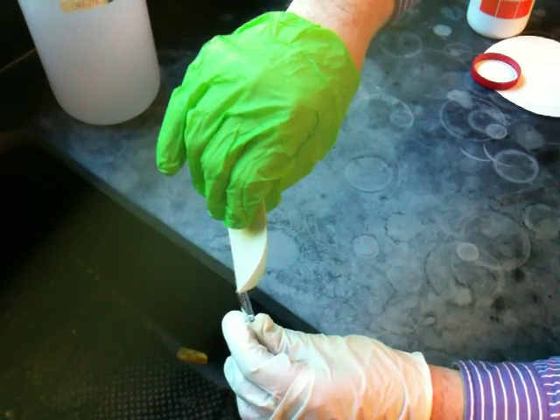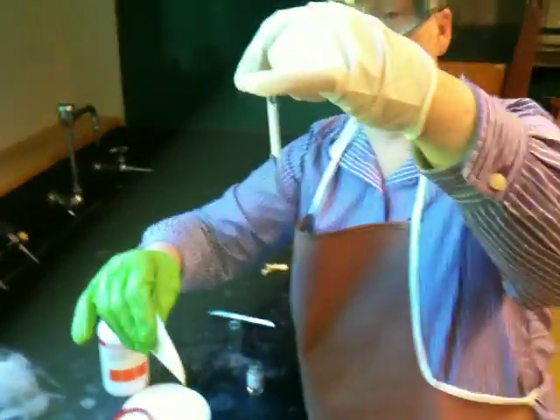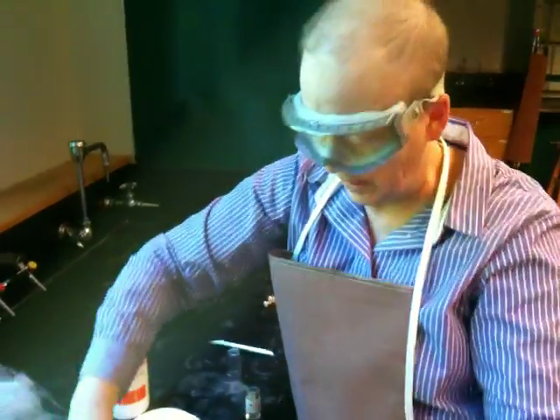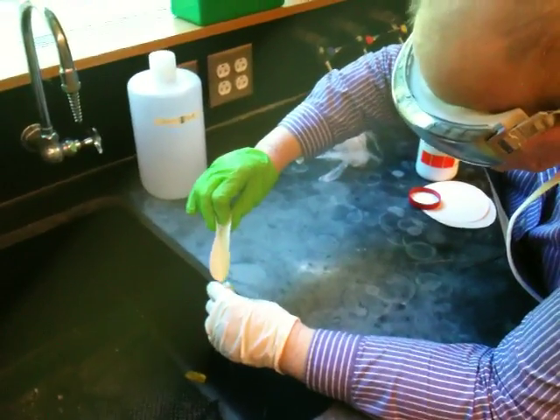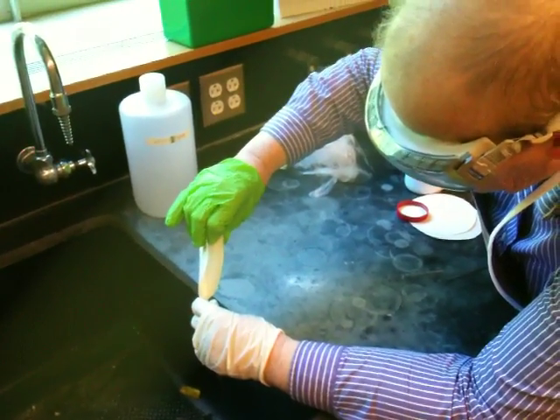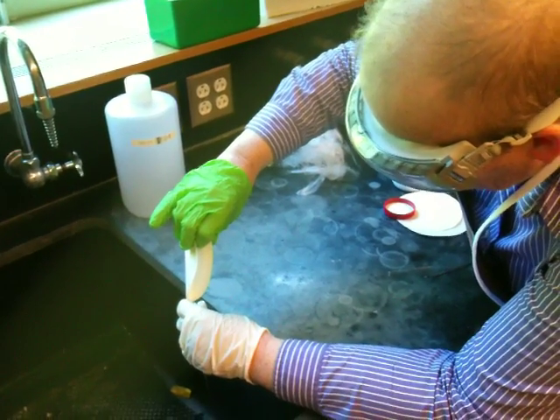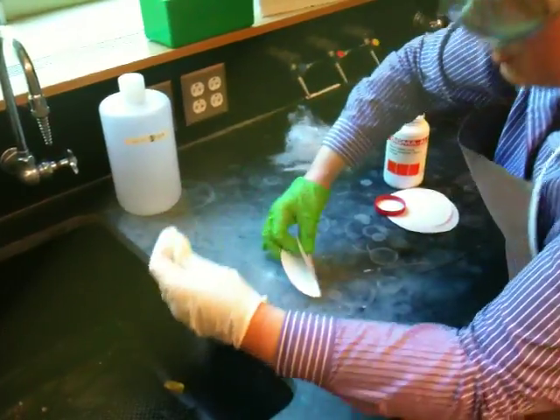And what I've got is a folded piece of filter paper. This is kind of how I recommend you do it. I'm putting it in. Now, oops. I've got about, the glass wool goes up to about here. There's a little bit of drying agent, so I want about double that. So I'm going to put some more in. Sodium sulfate is harmless, so if I spill a little bit of it, we can just wipe it up with a sponge. You wouldn't want to eat it, of course, but it's not something that you have to worry about getting a burn.